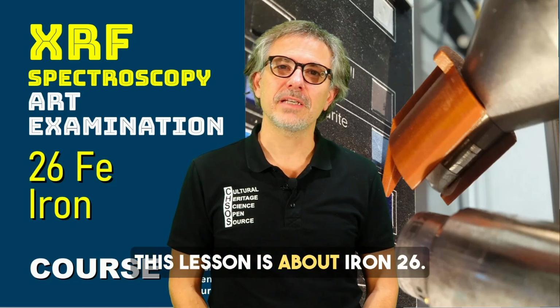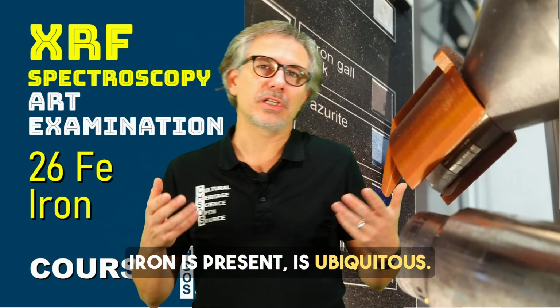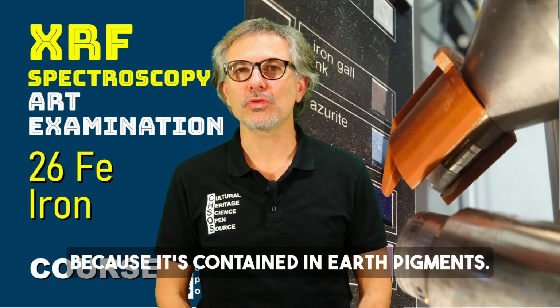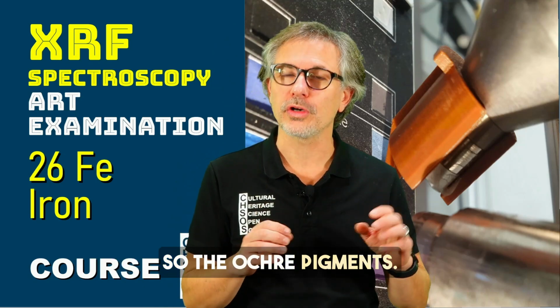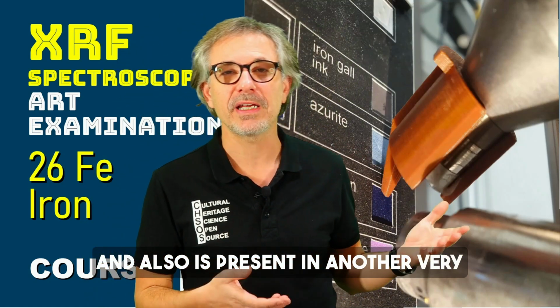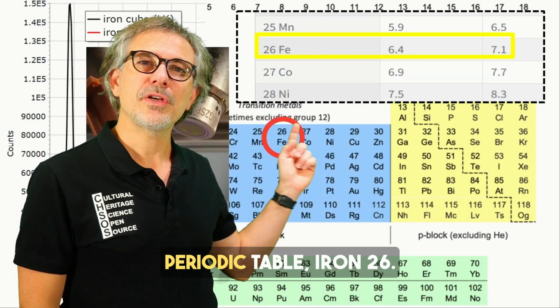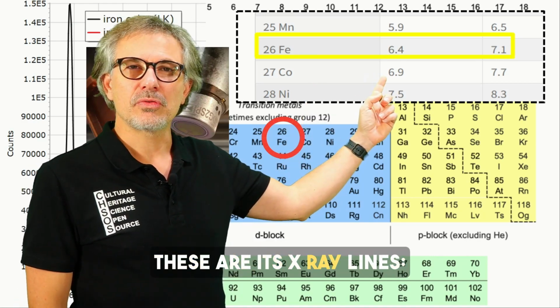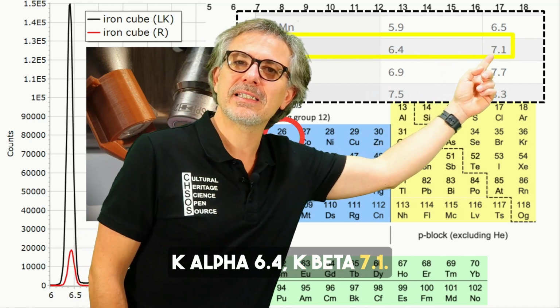This lesson is about iron, 26. Iron is present, is ubiquitous. We find it in most paintings because it's contained in earth pigments, so the ochre pigments, and is also present in another very widely diffused, popular pigment, Prussian blue. Periodic table, iron 26. These are its X-ray lines: K alpha 6.4, K beta 7.1.